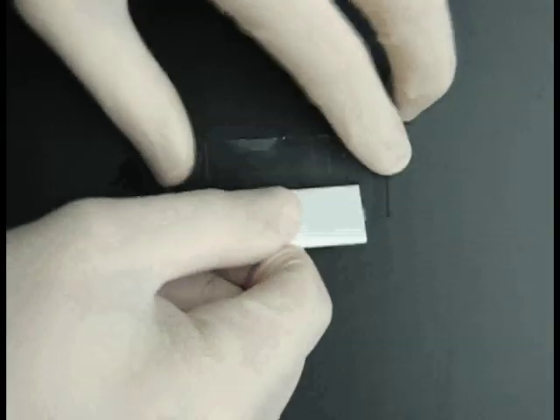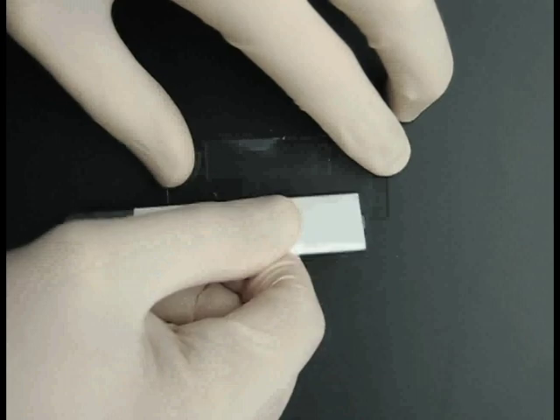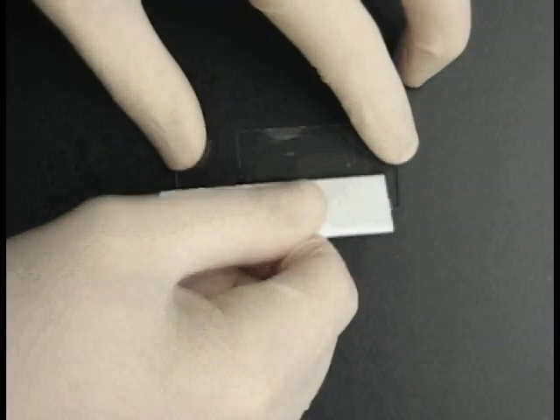Next, I use a box cutter to smash the tape to the slide. I smash the tape on the slide starting from the edge of the channel out. This helps prevent bubbles in the tape from forming.